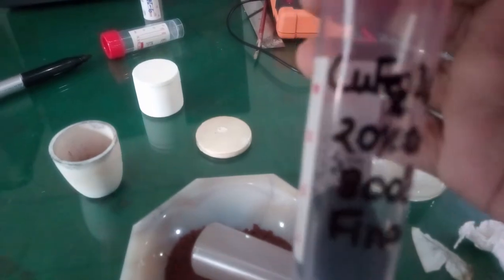You put this sample here in the sample container and mark this container. You can see here: copper ferrite titanium dioxide.